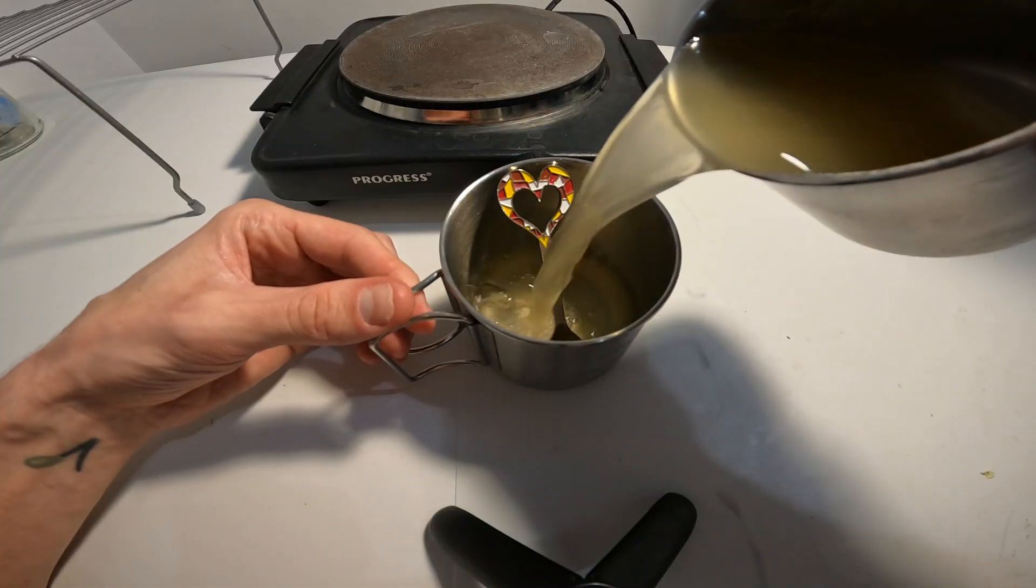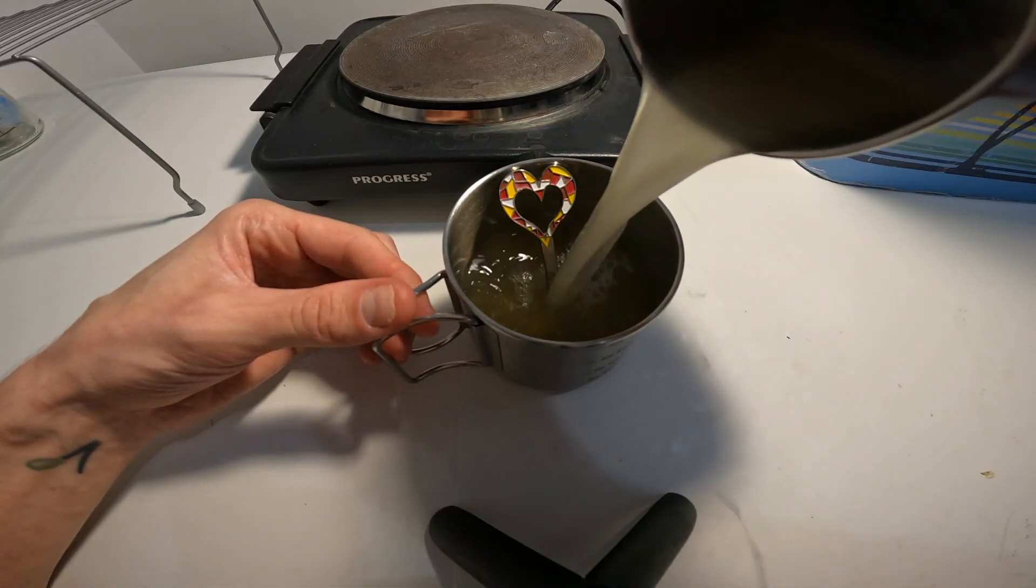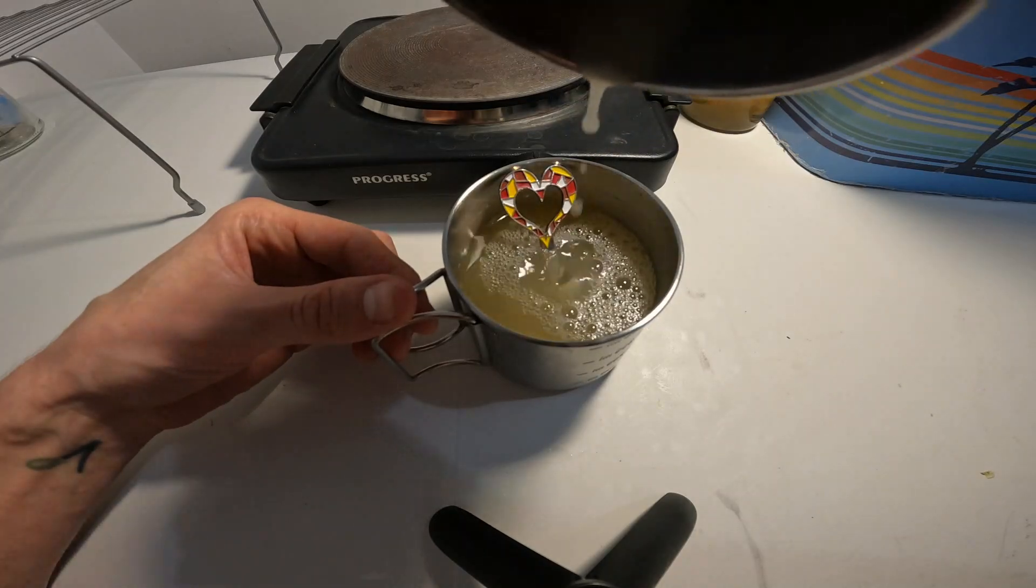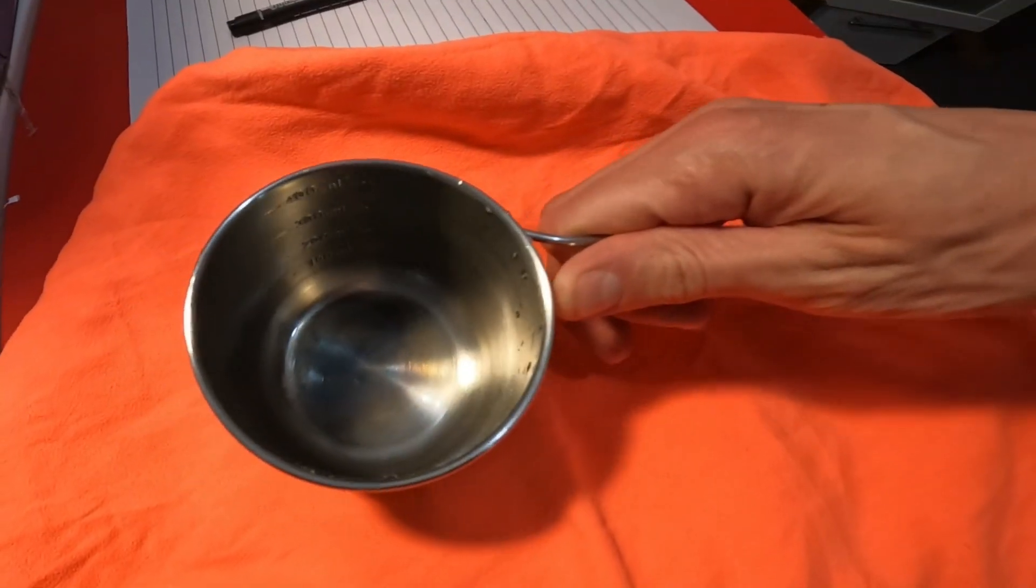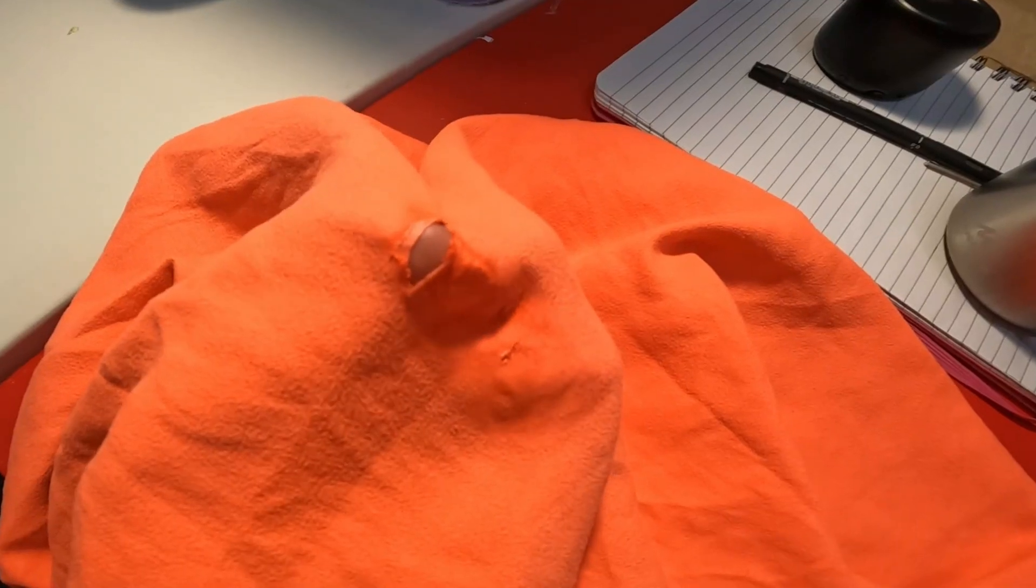I had to transfer the liquid into a different cup because the one I was using actually had melted plastic on the bottom from when I previously tried using it as a makeshift iron. Don't ask me why.